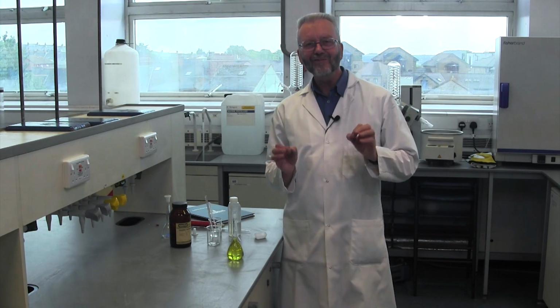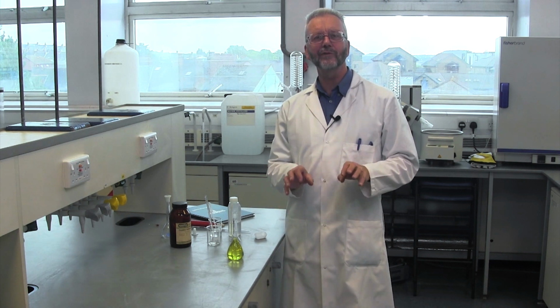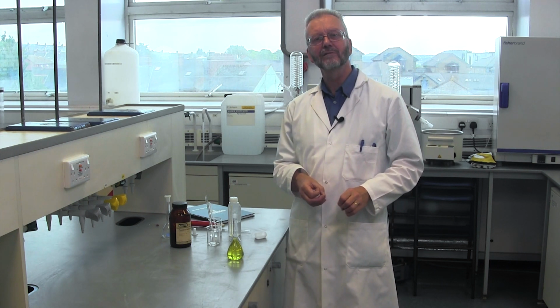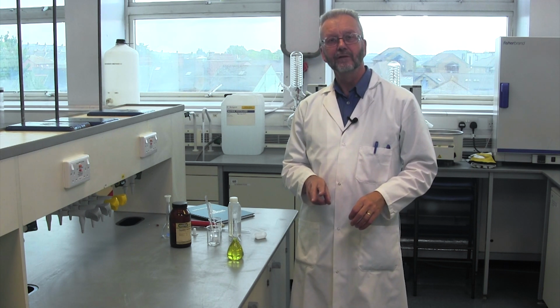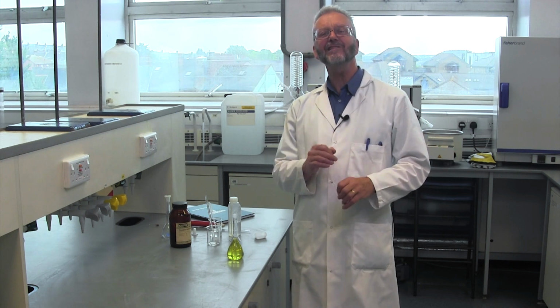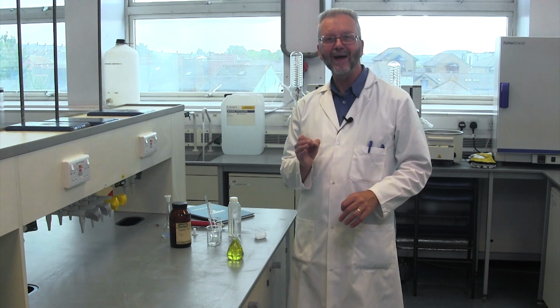The next step is very important. We have taken great pains to ensure that we know the mass of the solid used and that all of it has made it to the volumetric flask. However, concentration is made up of two terms: the number of moles of the solid dissolved and the final volume of the solution. It is therefore vital that we make up the solution to the correct volume accurately.